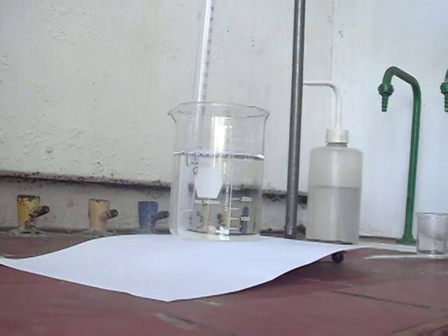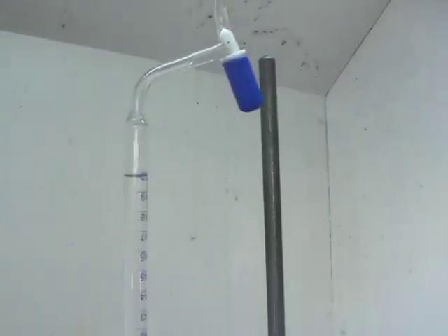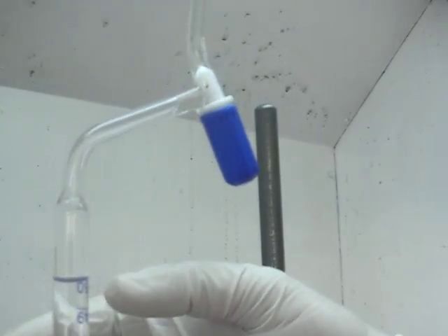Record your reading at the top when the volume of the water is steady at the top. We can see here it's around 50.2.